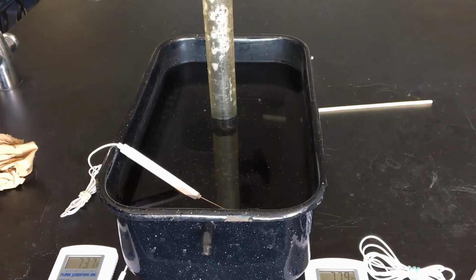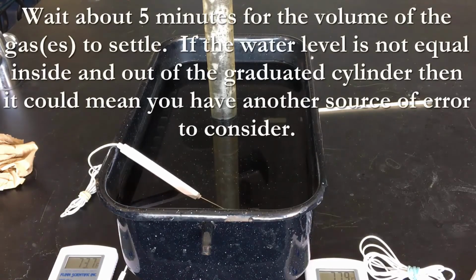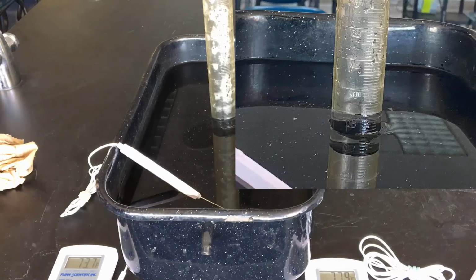So we've got our temperature of the water, temperature of the air, and the mass loss that should be butane, so that'll give us our number of moles. We have the volume now, and we can go to a weather app to check on the pressure.